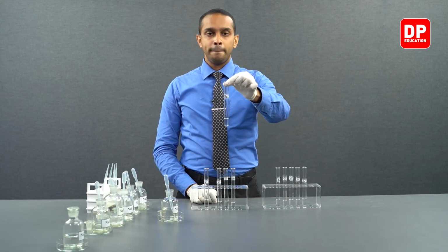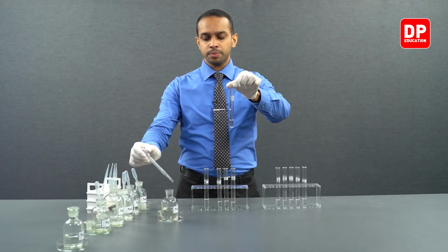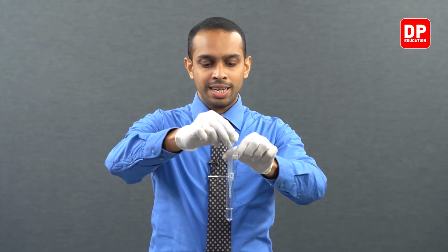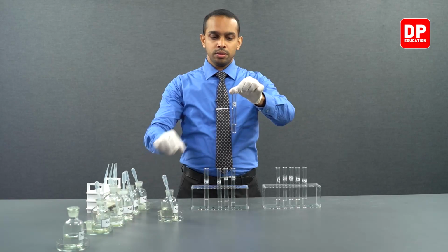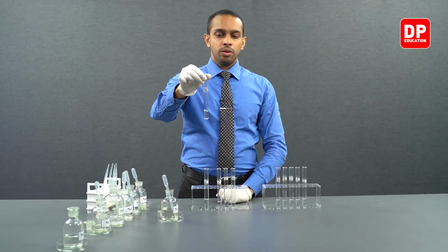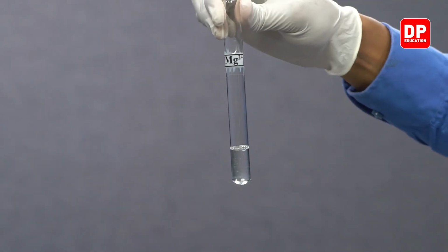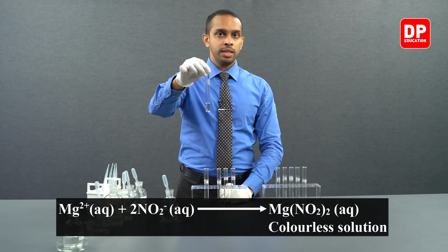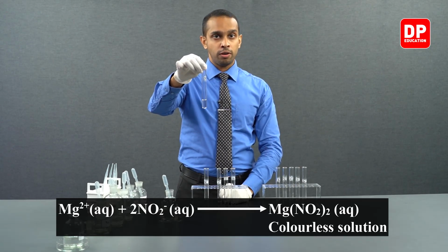Let's take magnesium 2 plus aqueous ion solution. To our magnesium 2 plus aqueous ion solution, we are adding a small amount of sodium nitrite, drop by drop. When magnesium 2 plus ions react with nitrite ions, it produces magnesium nitrite. Magnesium nitrite is soluble in water, so therefore we do not see the formation of a precipitate.